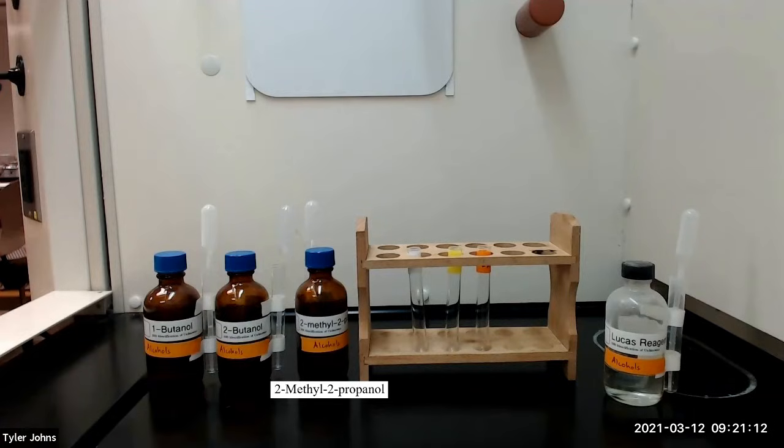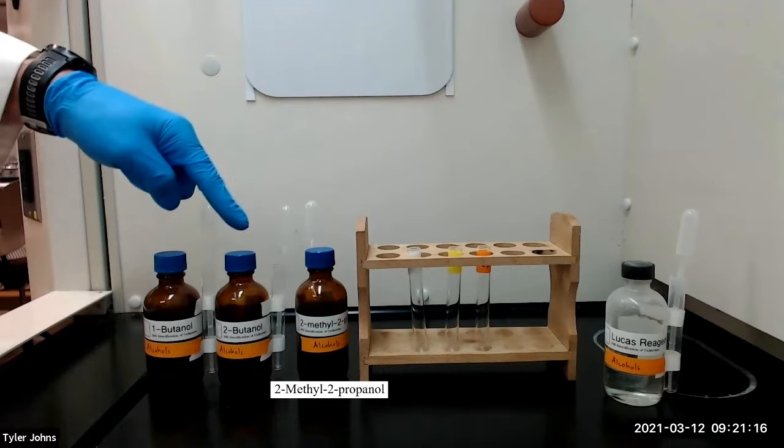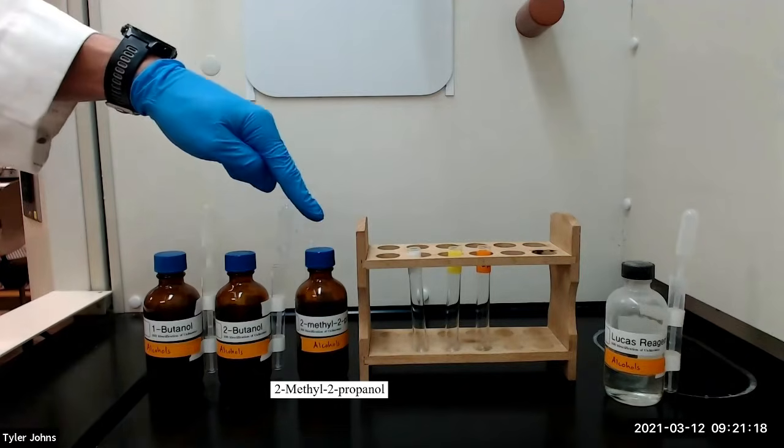We will now perform the Lucas test for alcohols using the test compounds 1-butanol, 2-butanol, and 2-methyl-2-propanol.